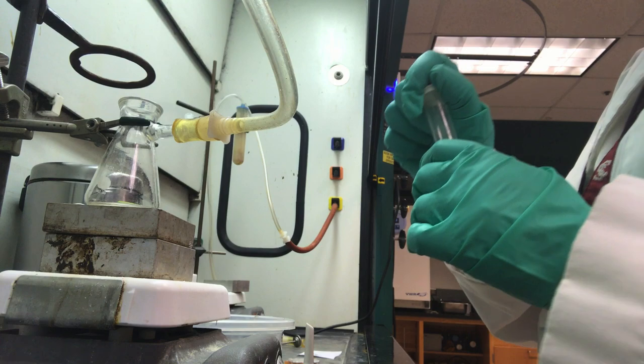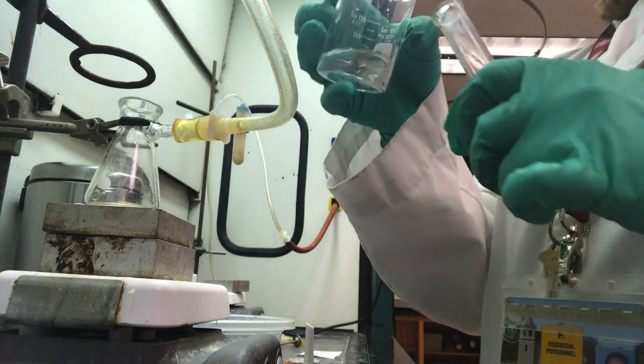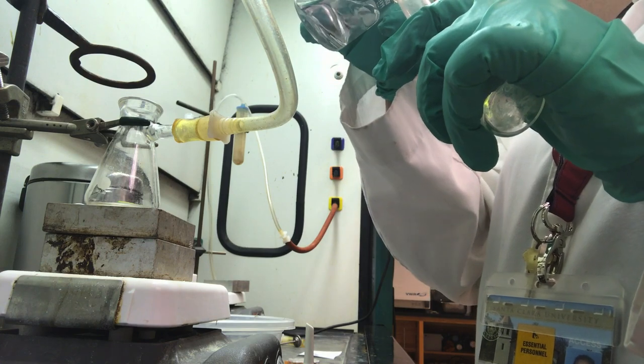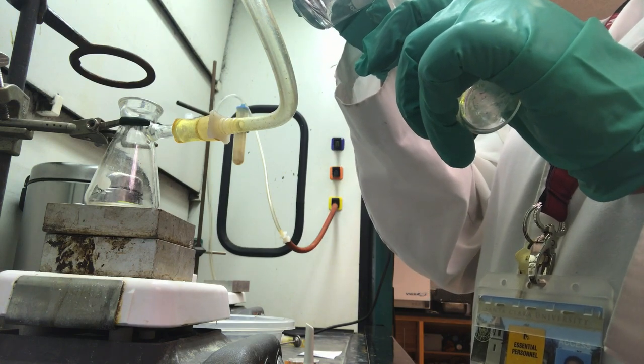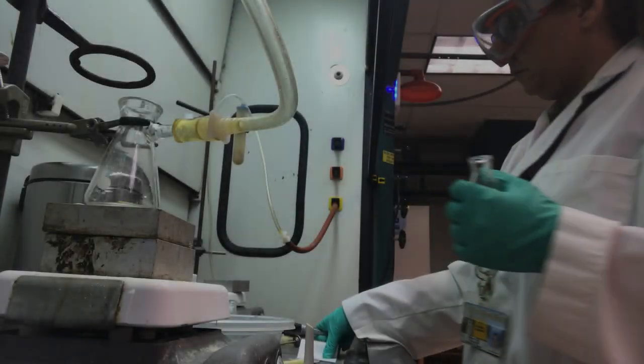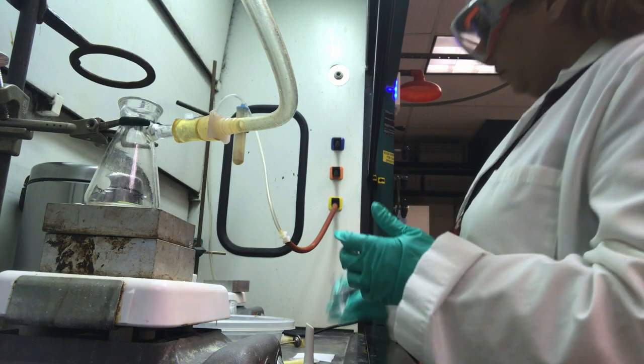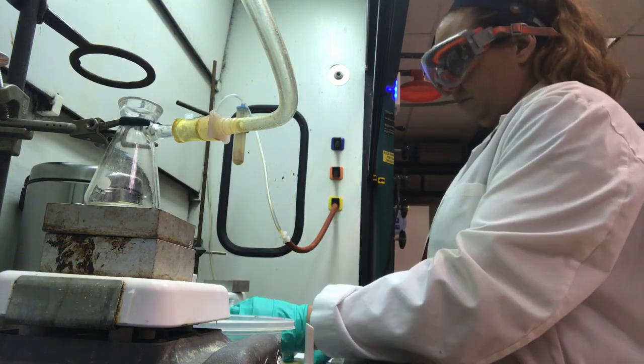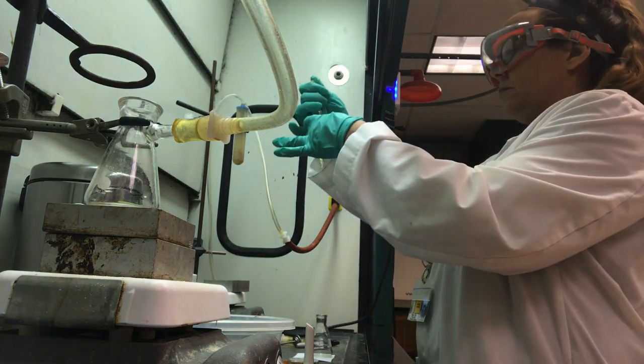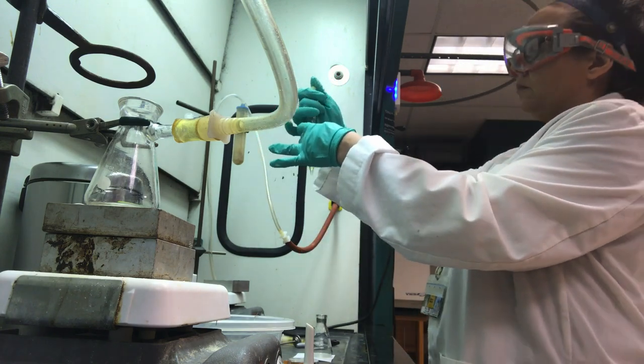It's time to isolate the amine from the mixture. Return to the ethyl acetate layer and extract it 3 times with 1.5 milliliters each of 3 molar HCl. Follow the general procedure you used for the extractions of the carboxylic acid with sodium hydroxide. Combine the acidic aqueous portions in a separate clean 50 milliliter Erlenmeyer flask that you label acidic extracts.